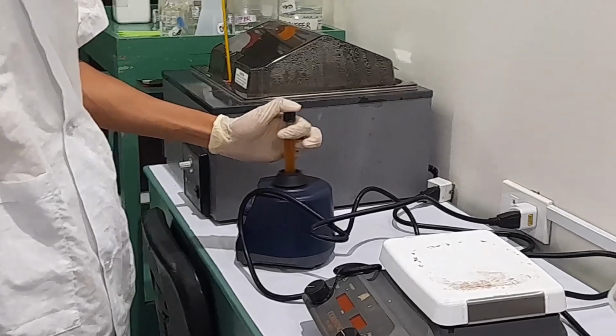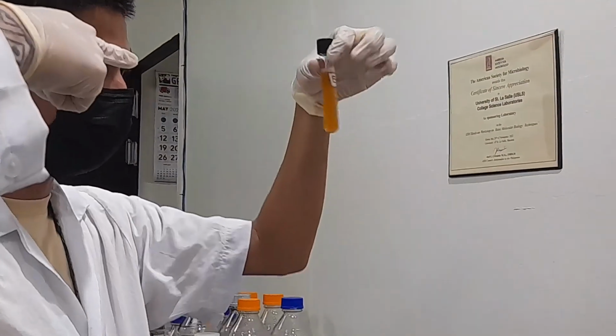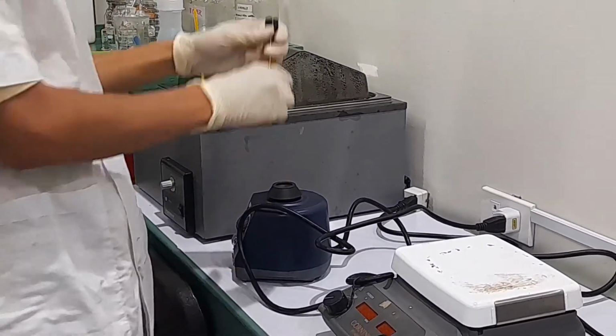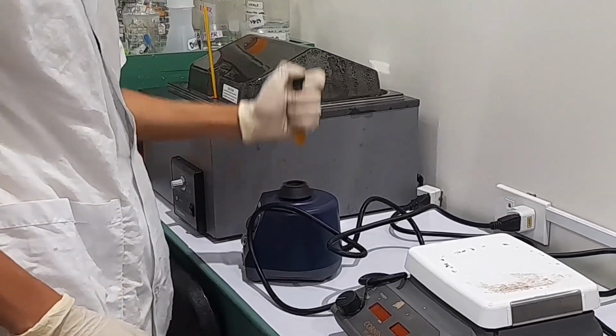Bacteria left for a long time inside the tube are going to settle at the bottom. So you need to agitate it so they go back into the solution. So that's a vortex, right? That's all it does. Just give it another, yeah. If you press down, it spins it. Okay, that's all that is.